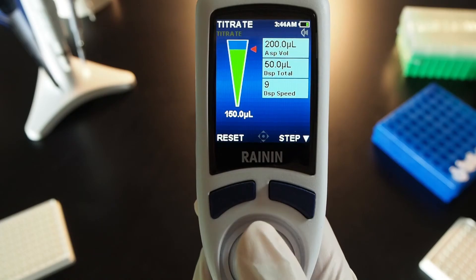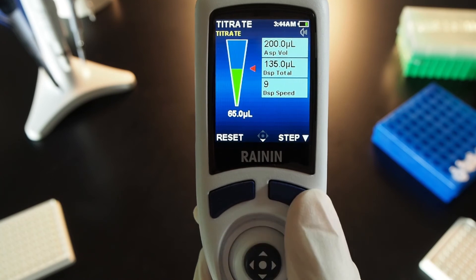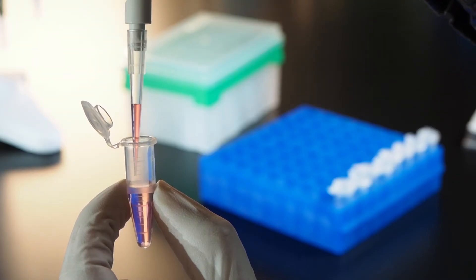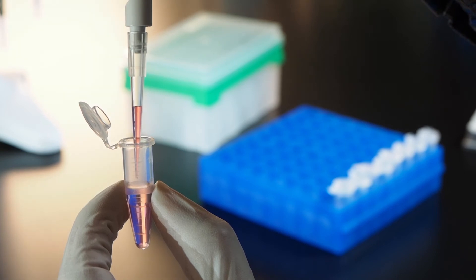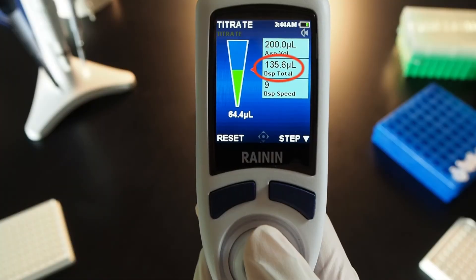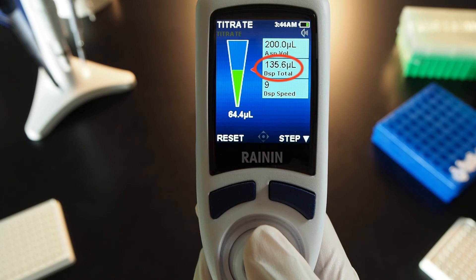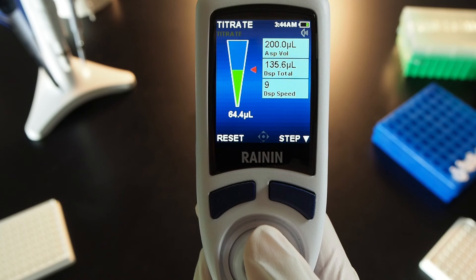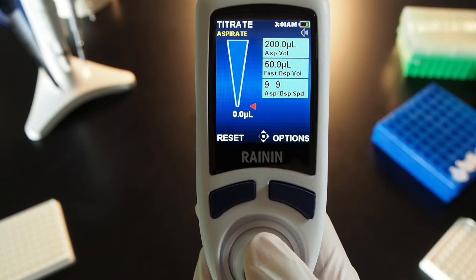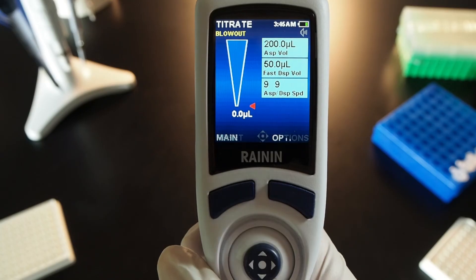From there, lightly press the joystick down to dispense slowly. Use the step button to dispense in 2 tenths of a microliter increments. Your titration volume is tracked in the center box — dispense total. Joystick down to dispense the remaining sample on the tip. Press reset to set up the next cycle.